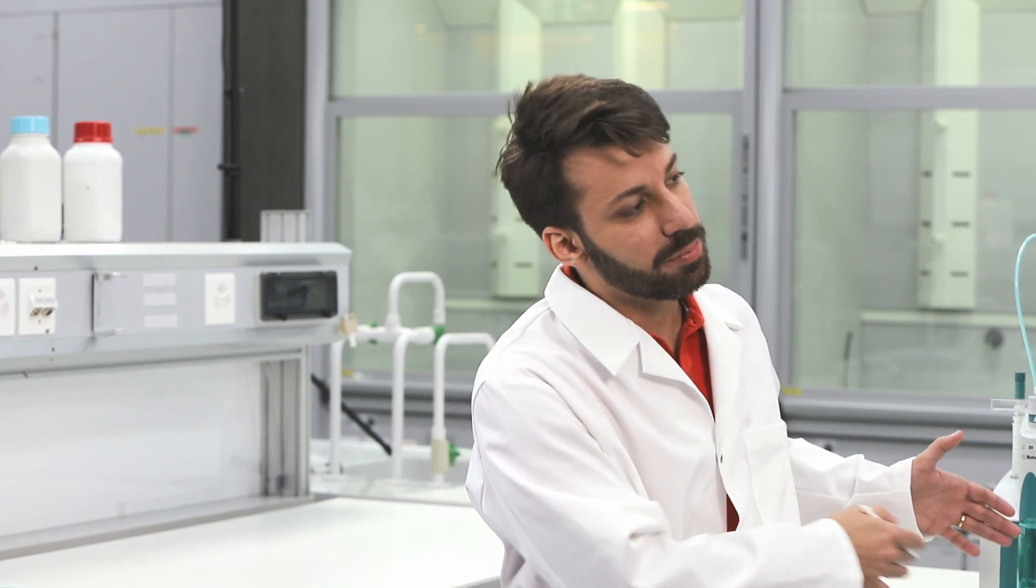First, the customer should clean up the burette frequently. And if they're not going to use it for a longer time, they should replace the titrant by deionized water to assure they will not have contact with aggressive media.